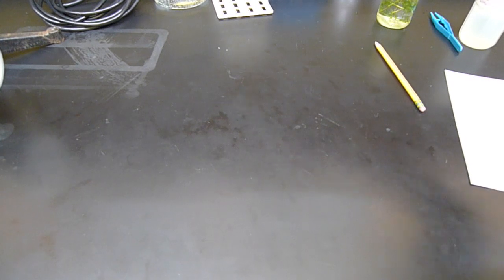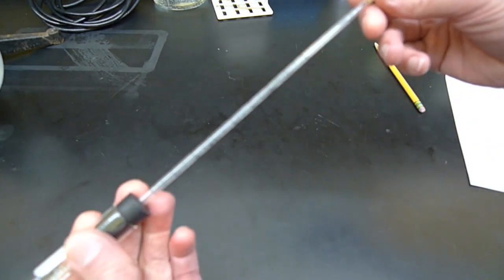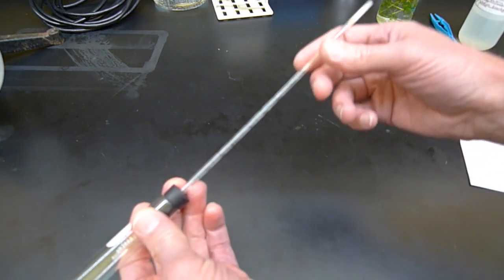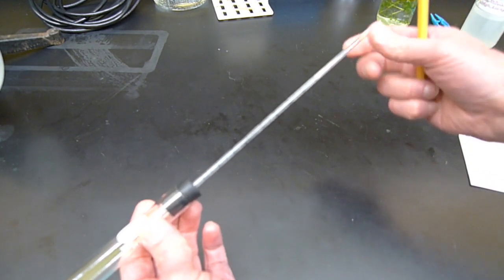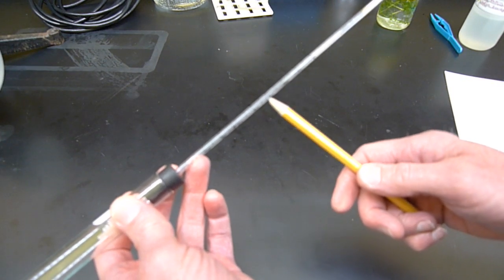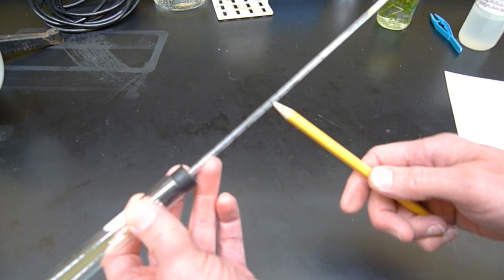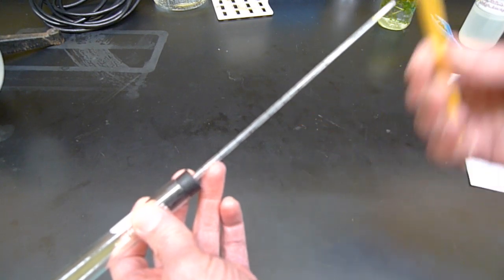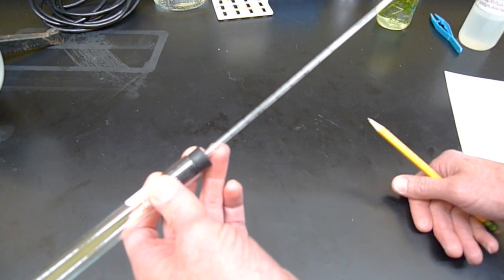This is not exactly what's described in the book. There's a test tube here with a stopper, and then this is a pipette. It's a tube that's used to measure relatively small volumes of liquid. And the pipette is subdivided, so this whole pipette will contain 1 milliliter of liquid. The smallest divisions, which is what I'm going to be using to measure the displacement of liquid in here, is in hundredths of a milliliter. So not millimeters as in the textbook, but milliliters. You need some sort of a scale to measure how much gas is being produced, and that's the way we do it.